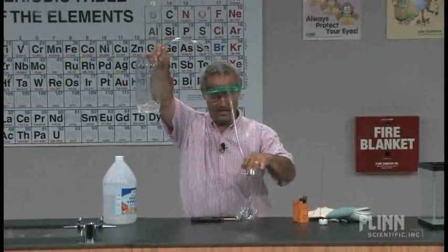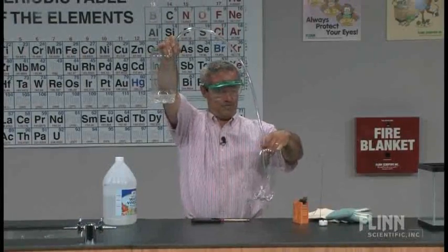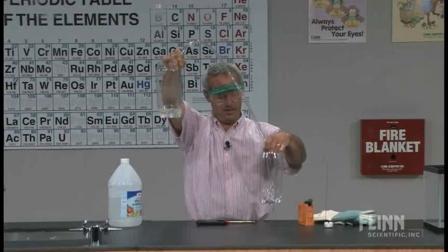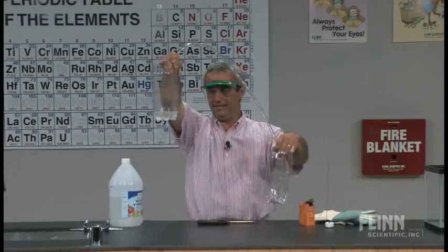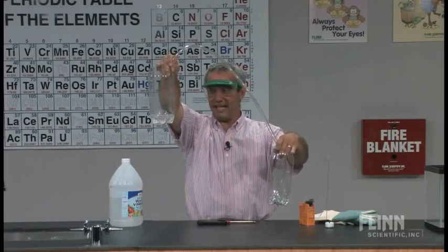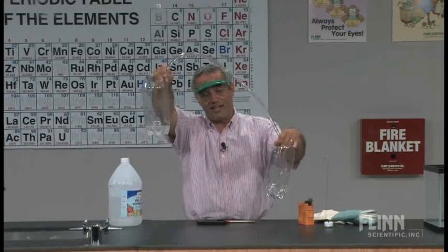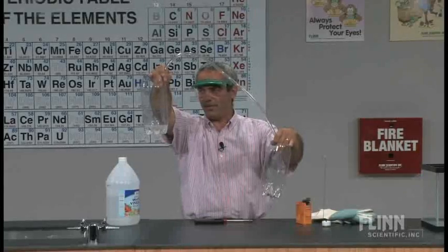Okay this is the most fun part of this demonstration. Lovely. Okay so this is one you kind of have to just wait on. If you think it's kind of boring to see it being poured, being siphoned is especially not interesting but I'm going to tell you a good joke here.